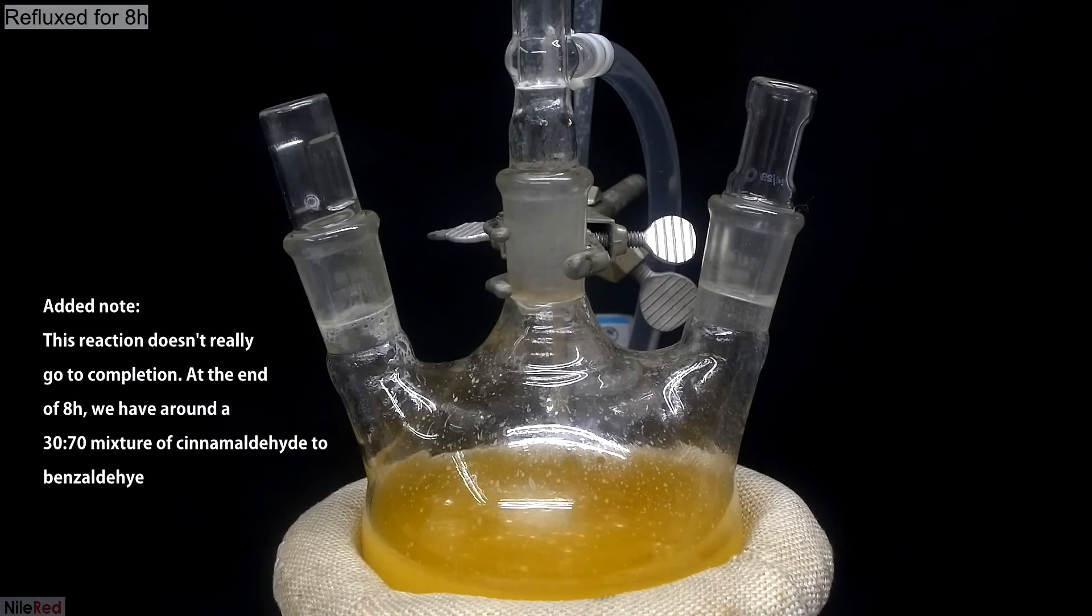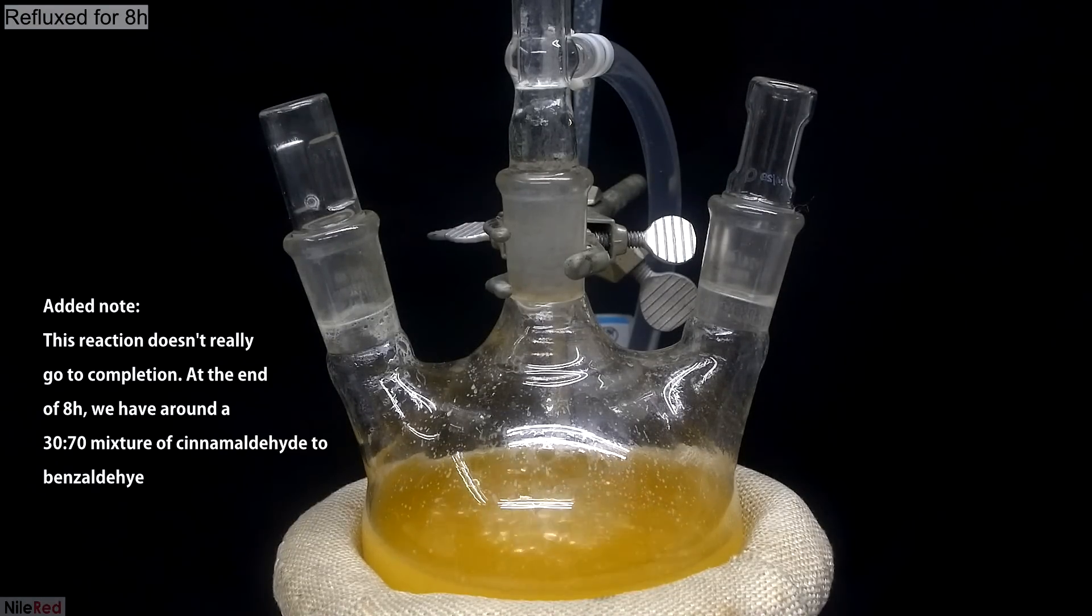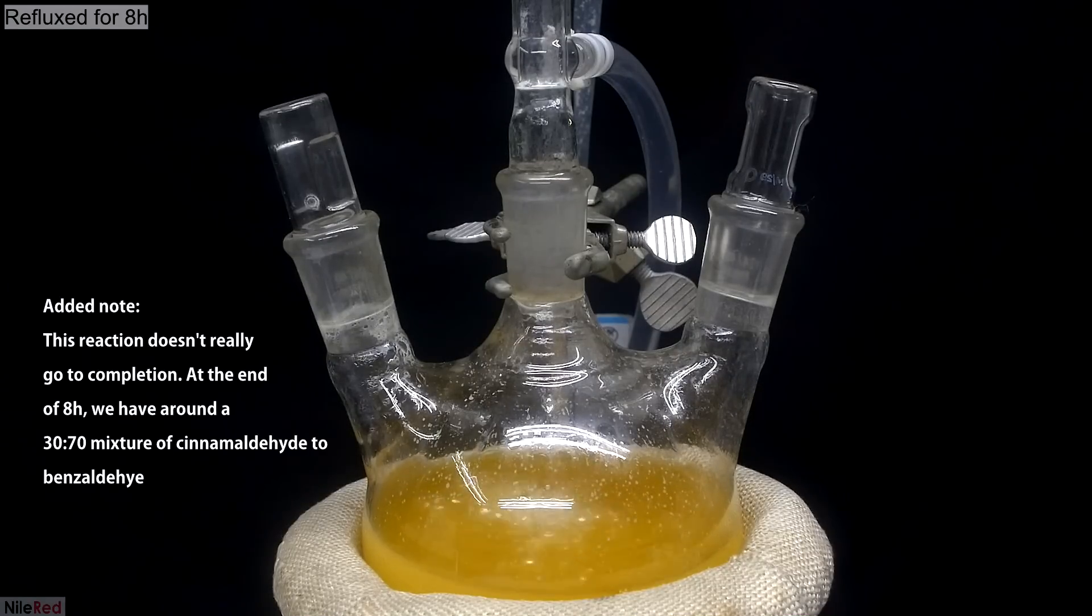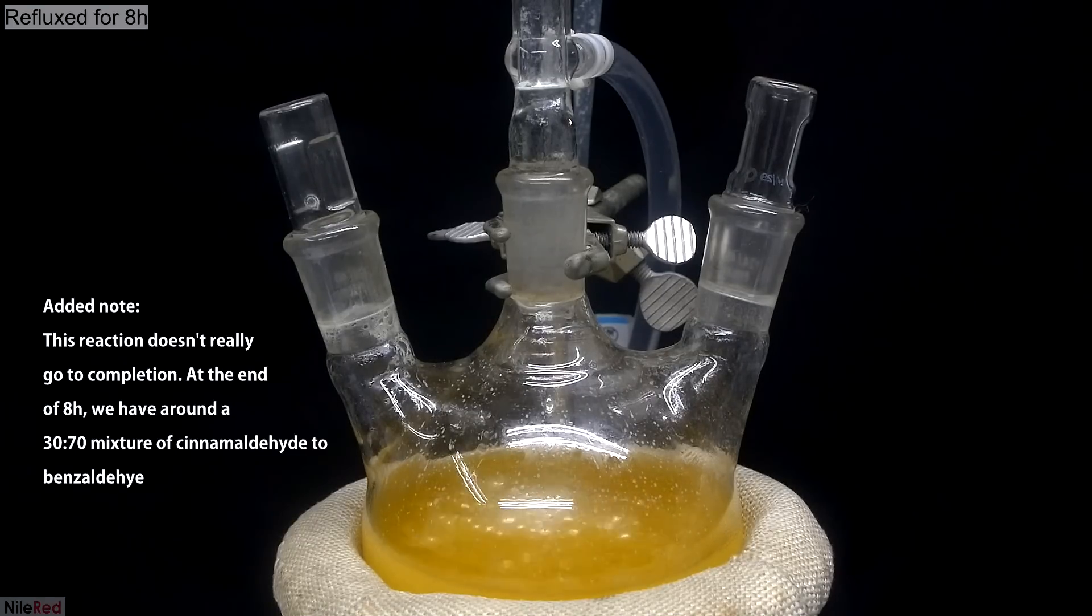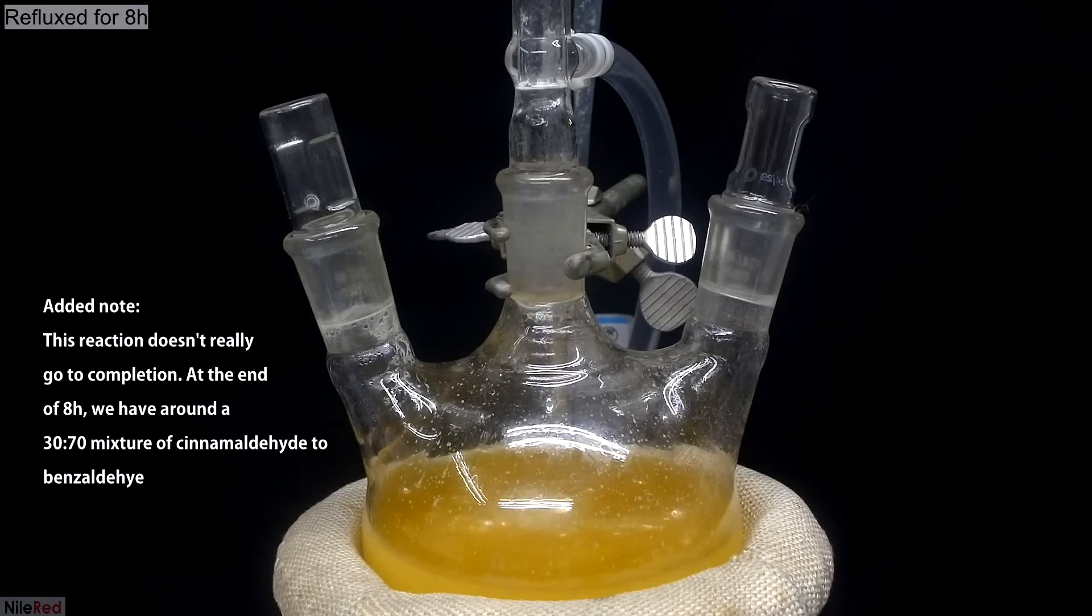Not too long after, we have a nice steady reflux going and you can see that things have turned a slight orange color. At this point, we start the timer and we want to keep this reflux going for about 8 hours.